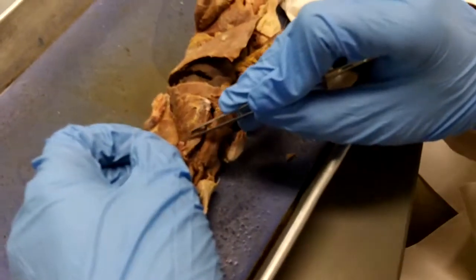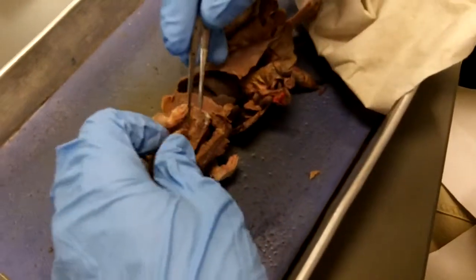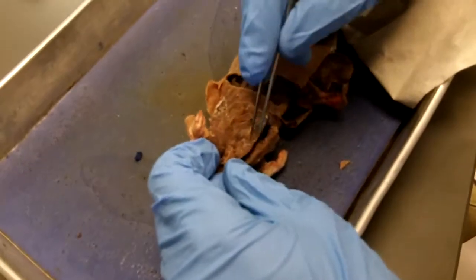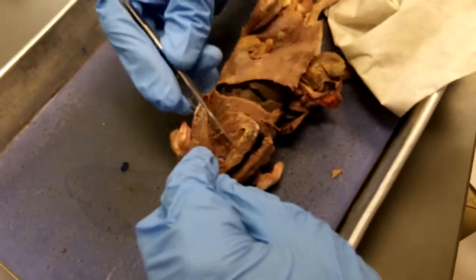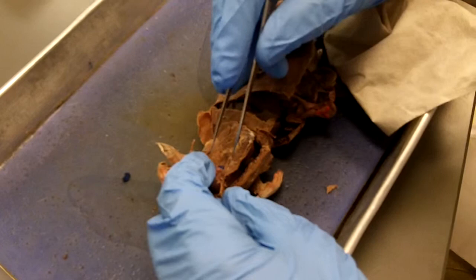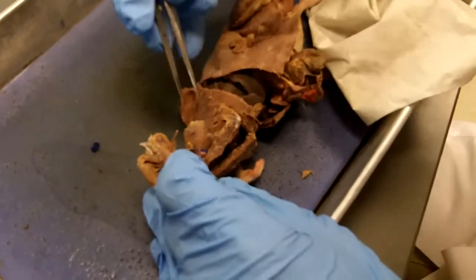There was this rectus thoracis, which is this little tiny strip of muscle that ran across like that. Is that one of the ones that we need to know? Oh yeah, rectus thoracis. And then this muscle, which is underneath rectus abdominis and lateral to it, actually goes all the way up like this, and it kind of overlaps the bottom of serratus ventralis. This one down here is called scalenus. Scalenus, not to be confused with splenius. So that's scalenus out there on the side.